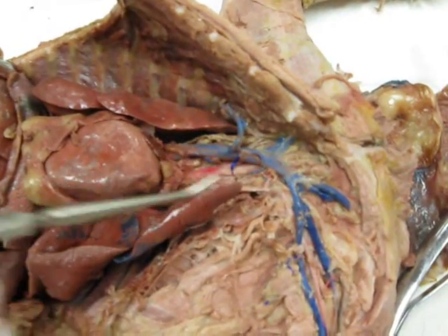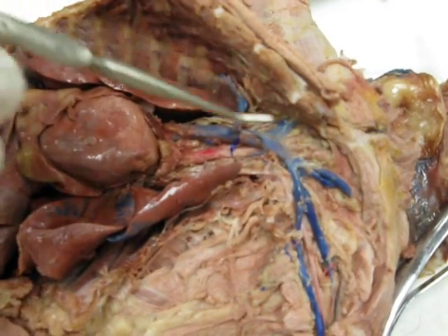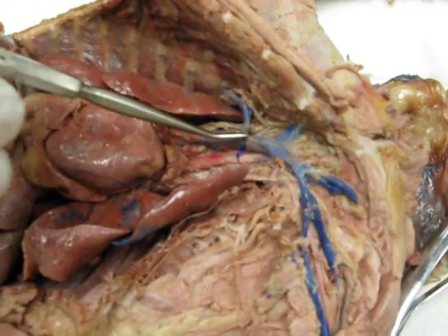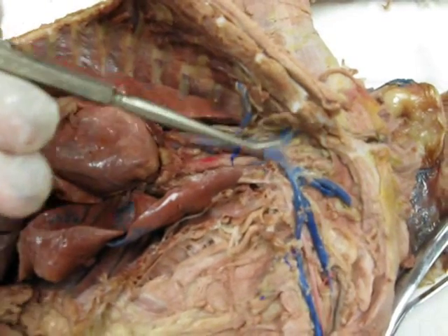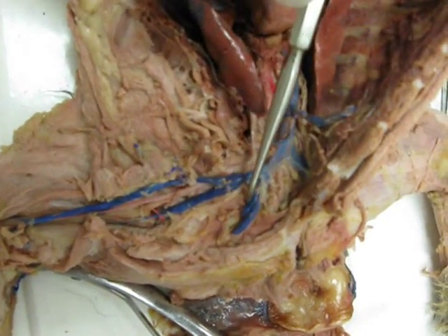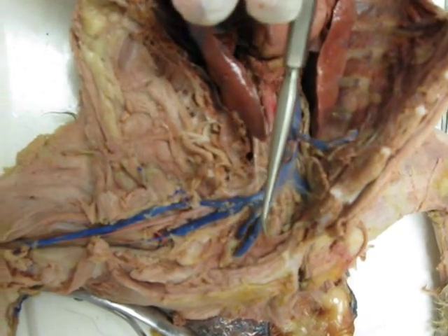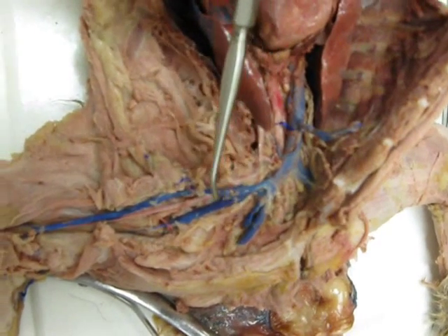the top of the heart, and your internal thoracic. Then your brachiocephalic veins are going to deliver blood to the superior vena cava. So you have a right and a left brachiocephalic vein. And then from there, you have your jugulars. And remember that your external and internal jugulars are based on their position. Internal closer to the midline, external farther away.